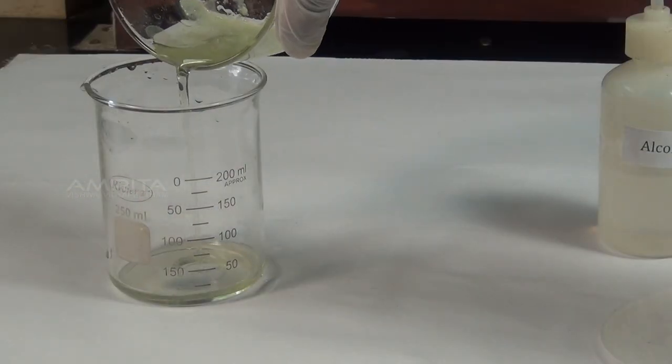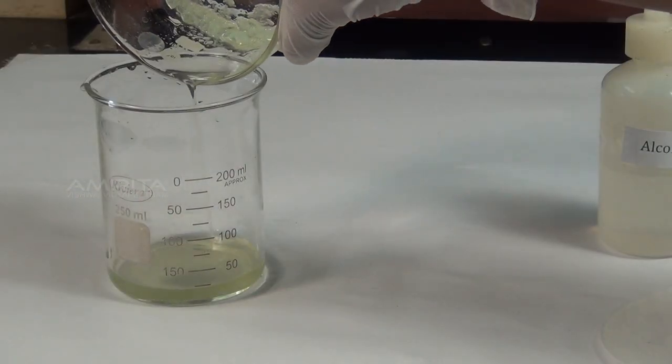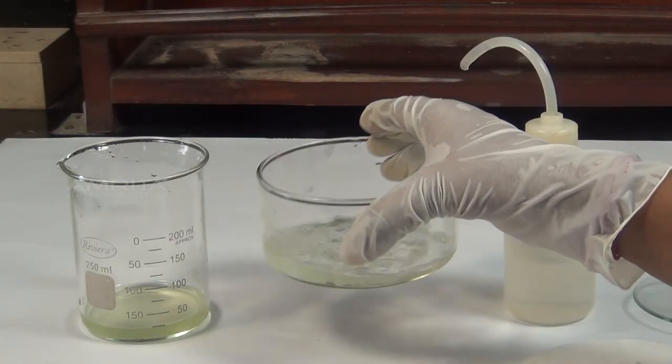Decant the mother liquor carefully into a beaker. Wash the crystals 2 or 3 times with a little alcohol.